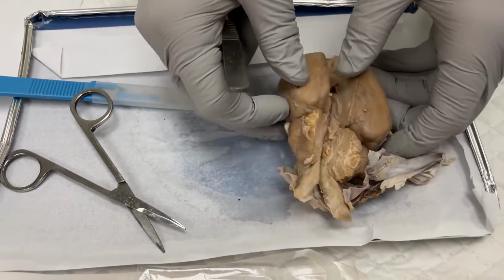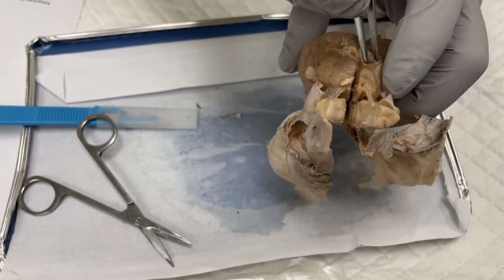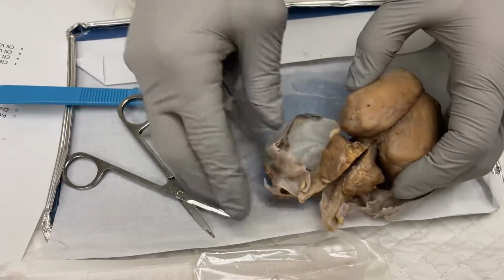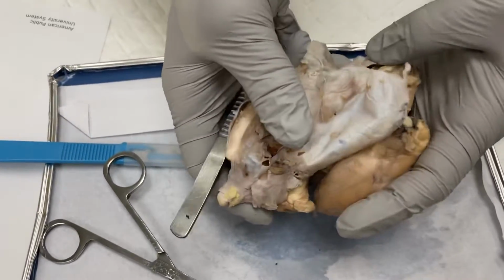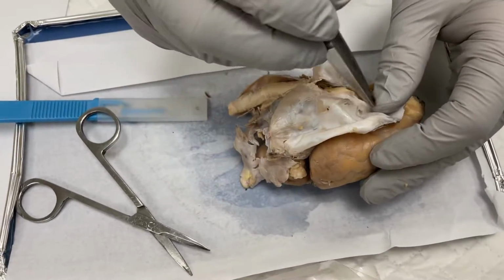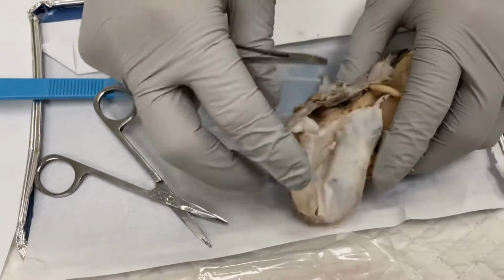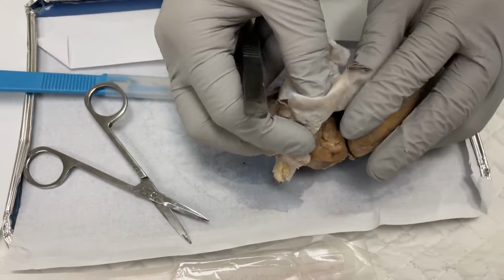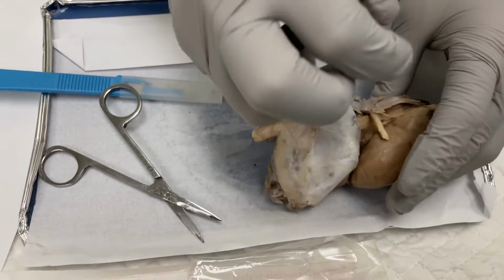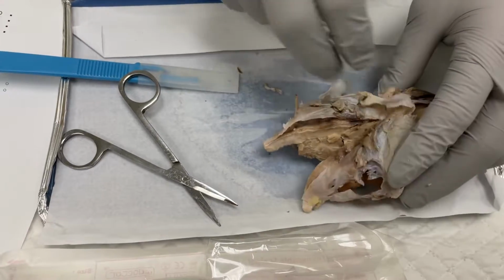And to look at the vermis, it's going to be the middle part, and that splits up the two lateral hemispheres. Up next, we have the meninges, which I've kind of taken off already. The outer part of the meninges would be the dura mater, and in between is the arachnoid, which you can't really cut, so you can't really see it, but it's the in-between part. The pia mater would be what gives the brain its shiny color.